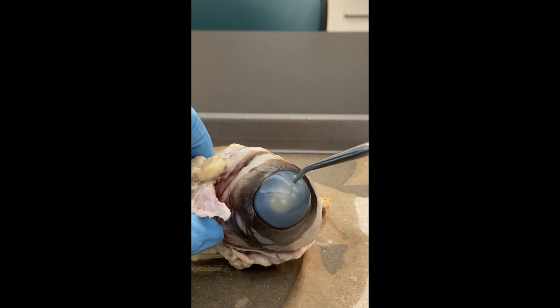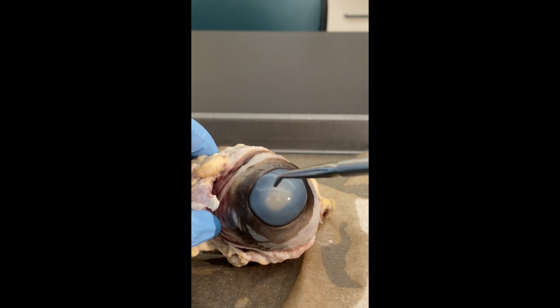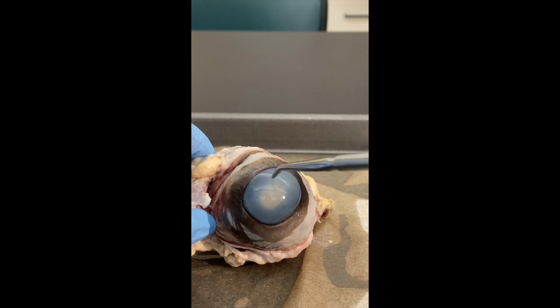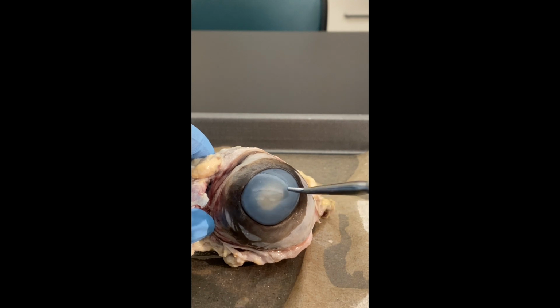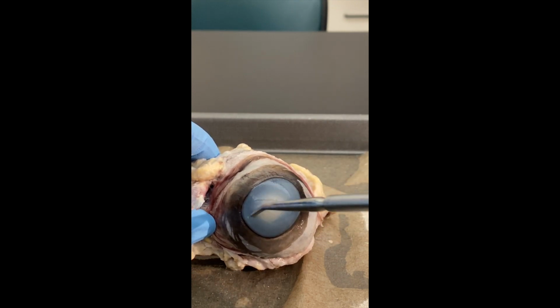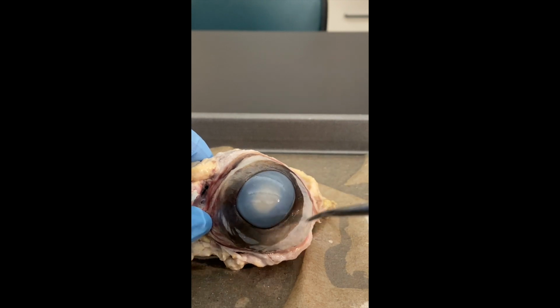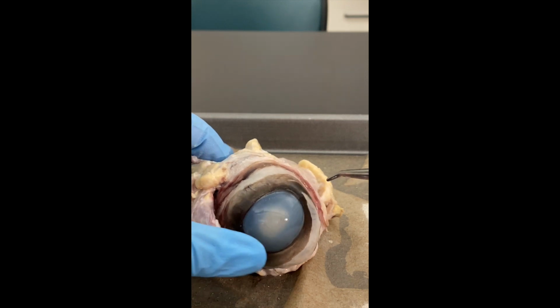So we have what's referred to as the cornea. Now the cornea tends to be transparent and clear when we look at each other's eyes, but because it's been in preservatives, the proteins have denatured and it kind of clouds up here like that. Now most of the eye is covered by what's known as the white part of the eye, which is the sclera. So the cornea only takes up a small portion of what's known as the fibrous tunica. So again, you've got the cornea, and then everything else that you see that's the white of the eye is going to be what's referred to as the sclera.